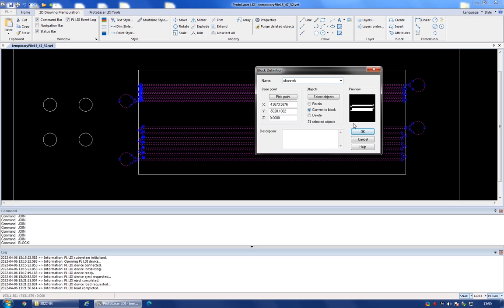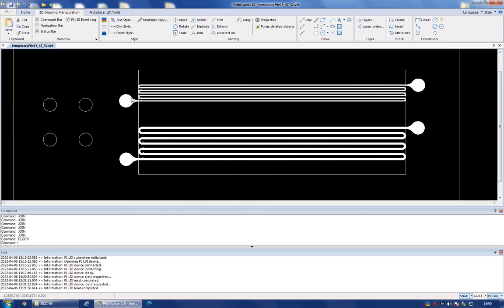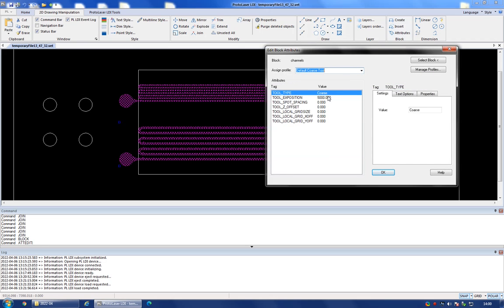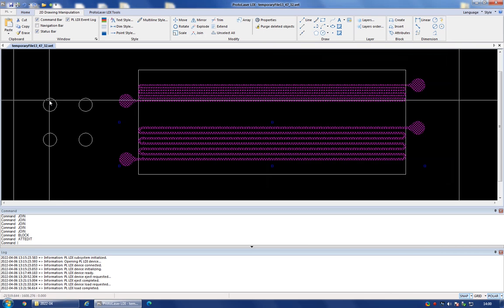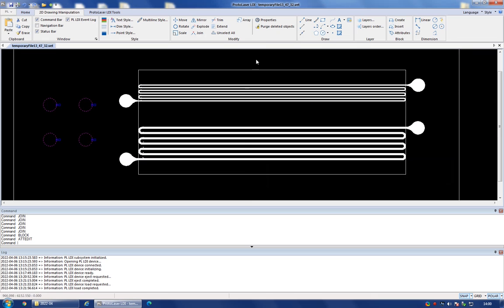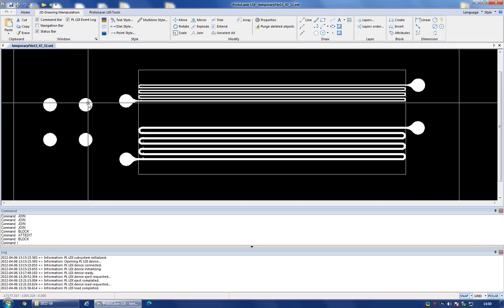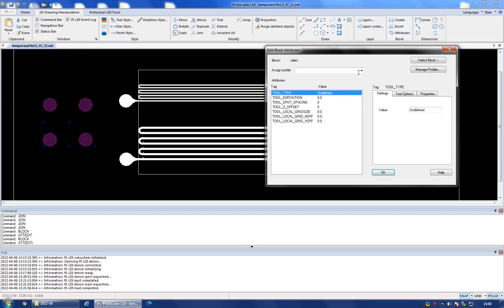Convert to block. I'm going to hit OK, and now you see that they've turned solid white in color. And now I'm going to select this block and set the attributes to the default coarse tool and 800 on that. So I'm going to hit OK, and now separately I'm going to create a new block for the inlets themselves, and I'm going to call it inlets. I'm going to hit OK. And that's it. So I'm going to also set the attributes for that. Default coarse tool, tool exposure, 800. And I'm going to hit OK.